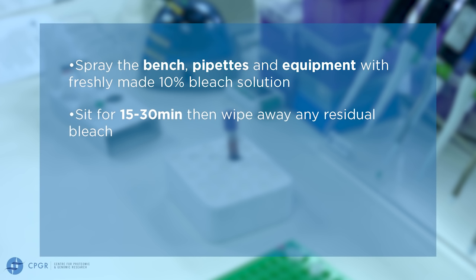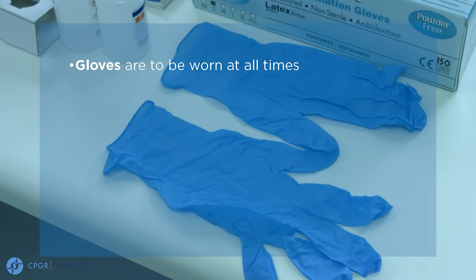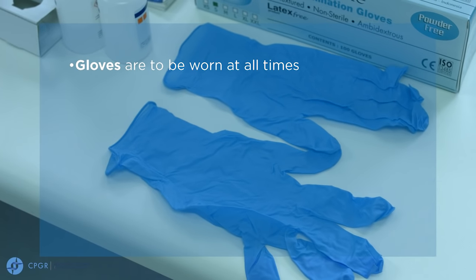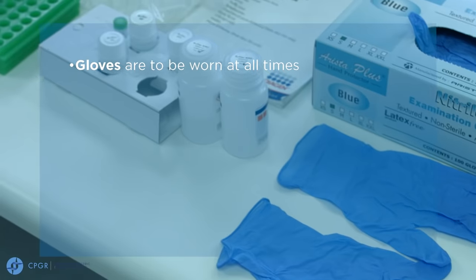Allow this to sit for 15 to 30 minutes and then wipe away any residual bleach, followed by rinsing with clean water and finally spraying with 70% ethanol. Gloves are to be worn at all times throughout the extraction process and changed frequently, especially if coming into contact with other surfaces that might be contaminated.